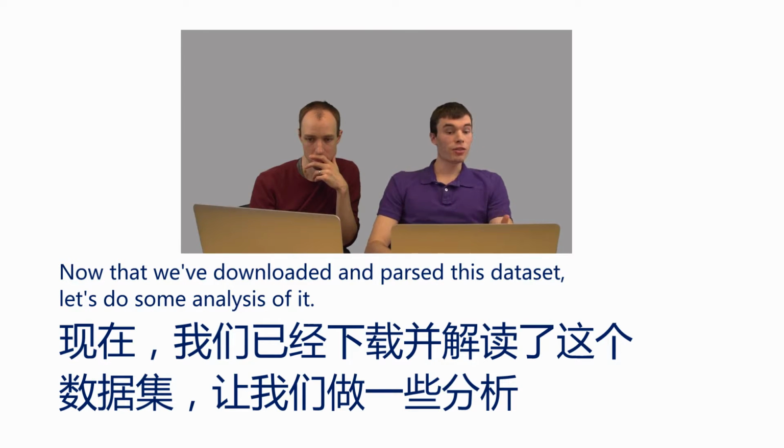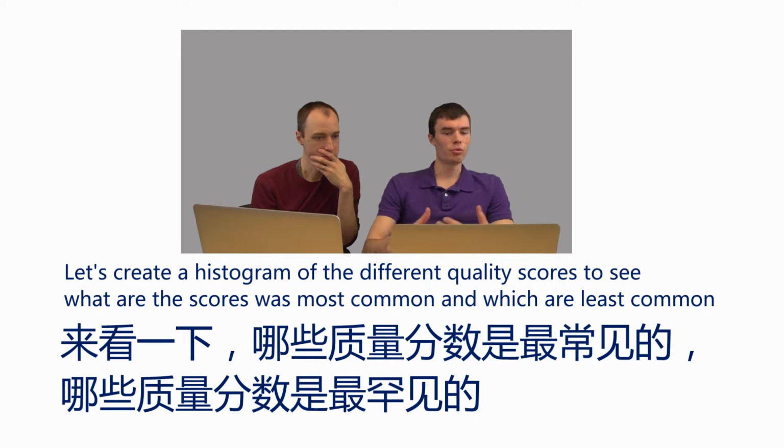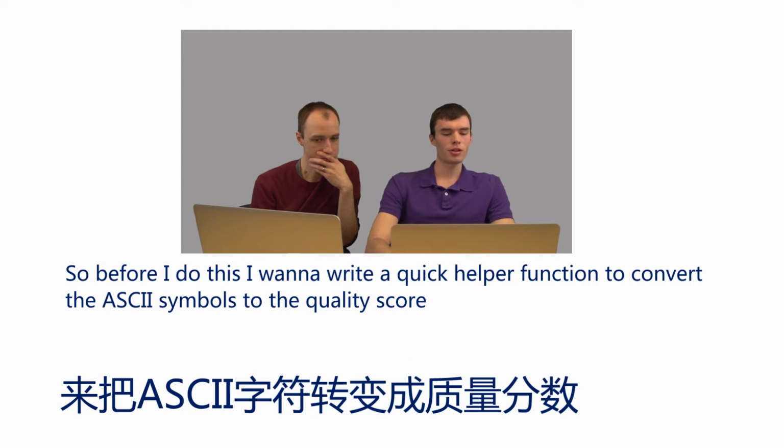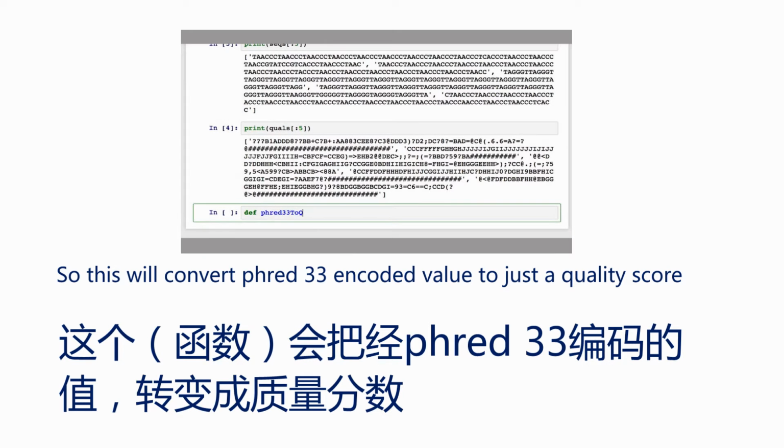Now that we've downloaded and parsed this data set, let's do some analysis of it. Let's create a histogram of the different quality scores to see what quality scores are most common and which are least common. Before I do this, I want to write a quick helper function to convert the ASCII symbols to the quality score. This will convert a Phred33 encoded value to just a quality score.